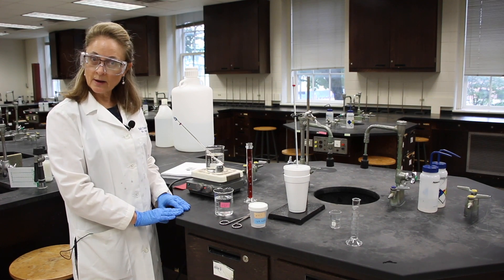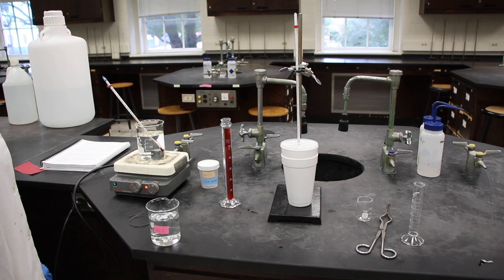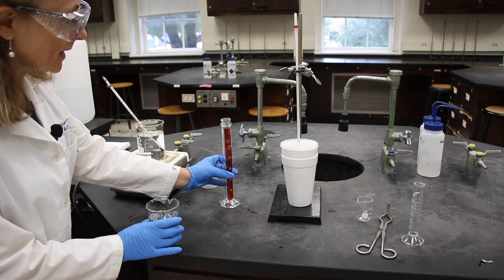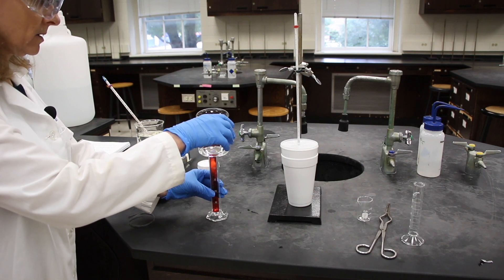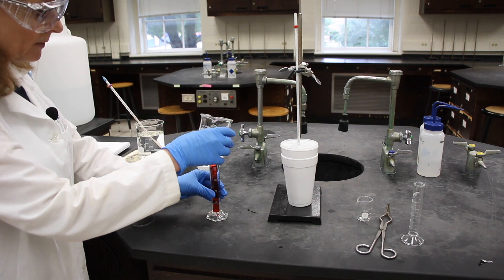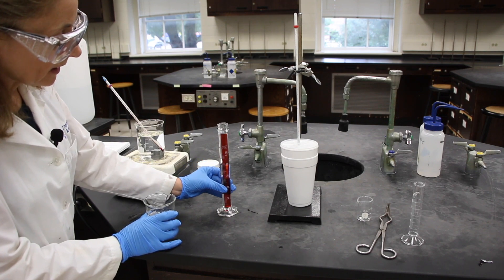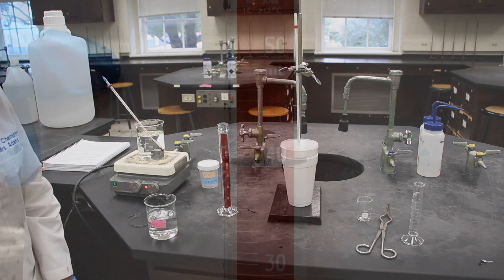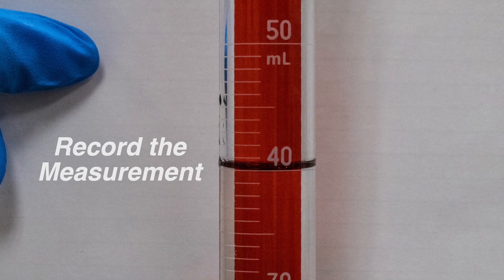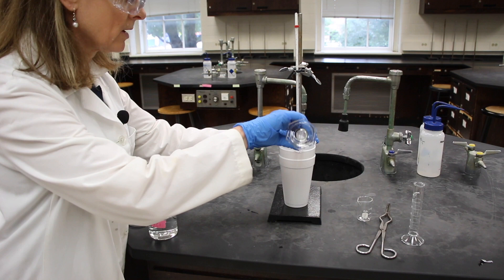Okay, we're done with our setup and we can start our procedure. In the first part, we will be determining the heat of reaction between magnesium and hydrochloric acid. I'll obtain about 80 mL in two additions of hydrochloric acid. It doesn't make any difference exactly how much you add — it just needs to be carefully measured. These divisions are in one mL, so you'll need to estimate to the tenth of a mL, or 0.1. Now that we've done that first addition, we'll pour it into our calorimeter setup.